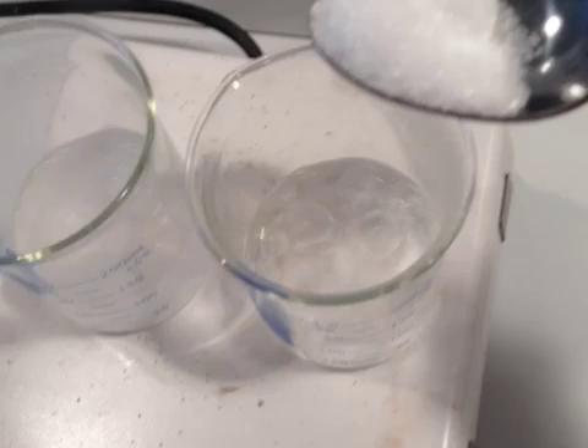When you start to see the water clouding up, slow down and add just a tiny bit at a time. Make sure you're measuring the amounts using the digital scale each time you add some salt. There's a lot of work for everybody to do — people can be measuring, people can be getting equipment, people can be adding salt to the water. Everybody needs to be aware of their surroundings because we're going to have a lot of hot chemicals and we don't want anybody to get hurt.